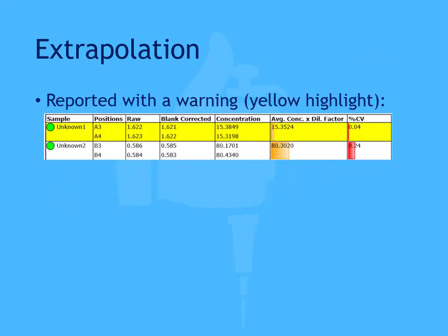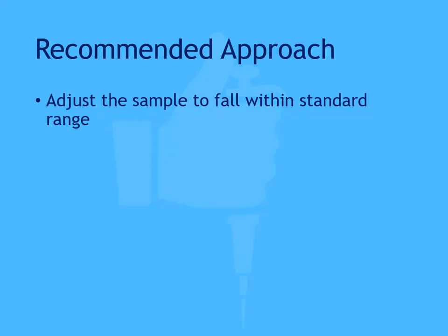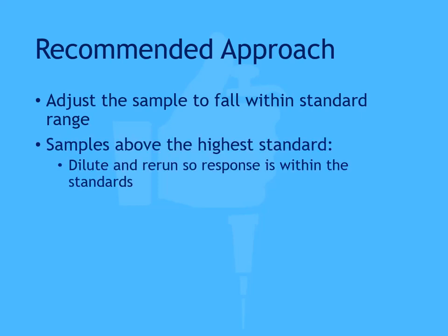In some cases, data analysis software such as MyAssays might report an extrapolated concentration with a warning, while in other cases it does not calculate a concentration and instead reports above or below the curve. For samples outside the standard range, the recommended analytical approach is to rerun the sample at an appropriate dilution or concentration so that the corrected response falls within the standard range. For samples above the highest standard, the usual recommendation is to dilute the sample and rerun it so that the response falls within the calibrated range.